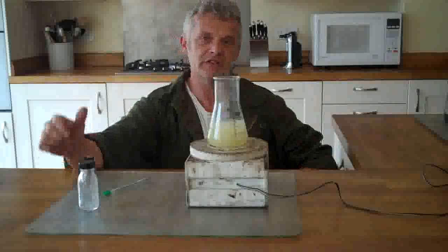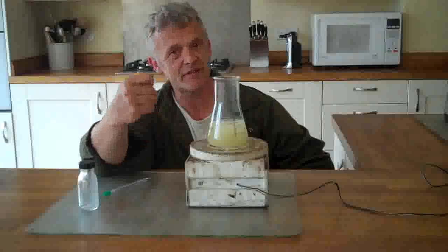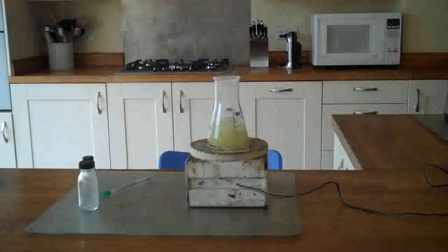You can see it turning yellow already as the reaction happens. Because the reaction is not at full heat we're going to have to leave it stirring for about 50 minutes, and again it will go that nice red colour. Copper oxide is a very deep brick-red, so you'll know if you're getting copper oxide — it's the salmon-pink that you're looking for. After 50 minutes the polyol reaction is done and you can see the beautiful pinkish-red colour — that's a whole host of copper nanoparticles capped in PVP. The ascorbic acid in there is scavenging any oxygen and keeping them as copper metal, and the PVP is keeping them in suspension — that will be stable for months. You can centrifuge it, collect the nanoparticles, wash them in ethanol, and then use them as an ink sintered by a flashlight.